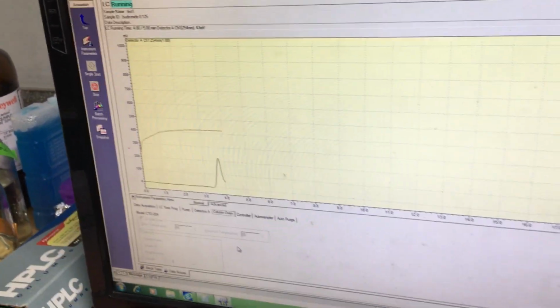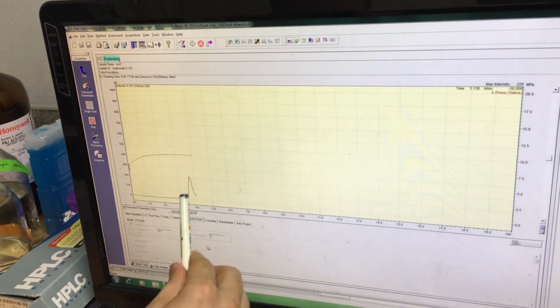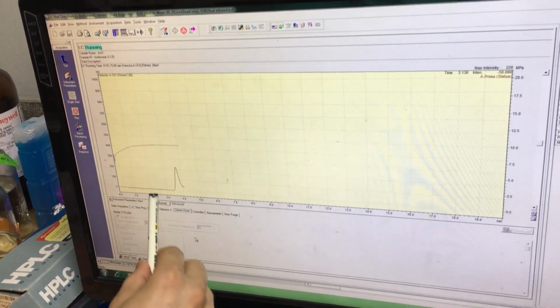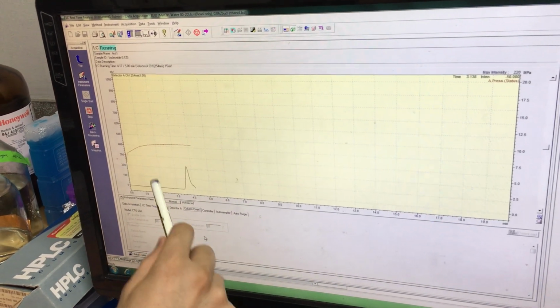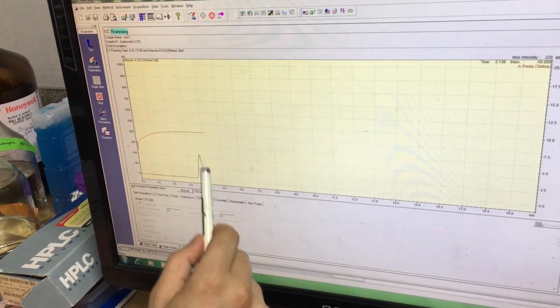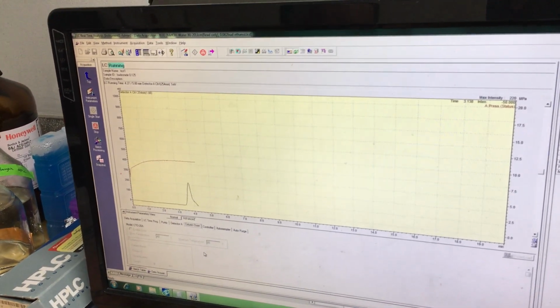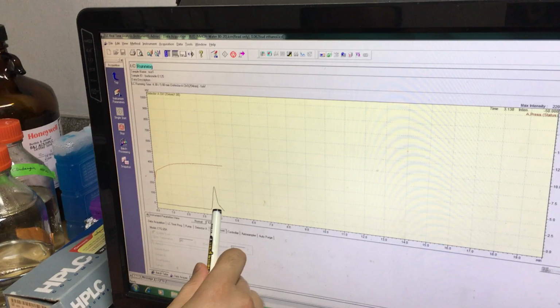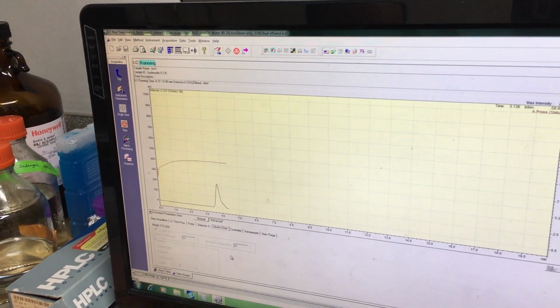So this means your column, your drug, if you have two drugs or impurities, there should be some extra peaks. It means the drug is pure. There are no impurities. There's nothing. So you can say only this drug gave a peak.